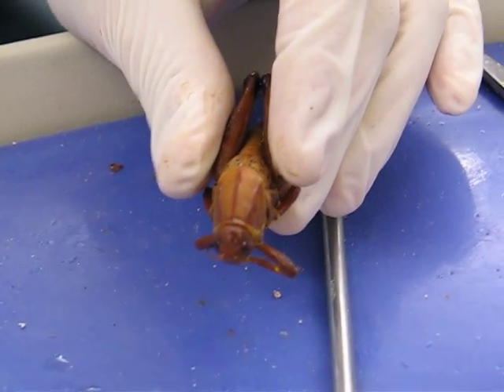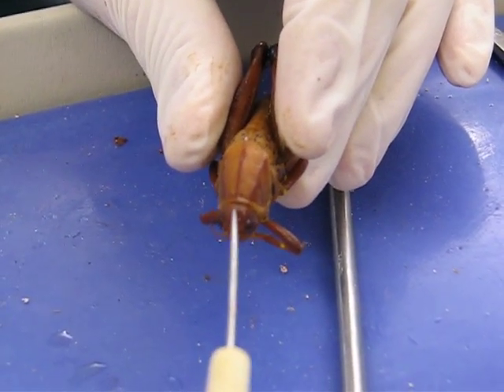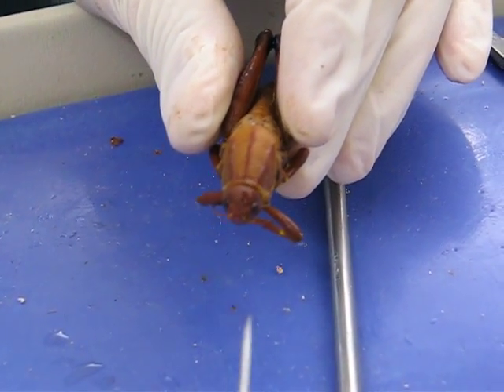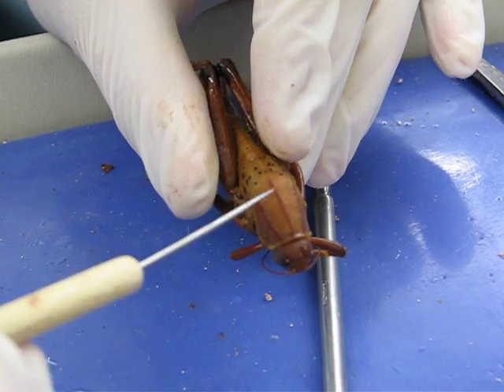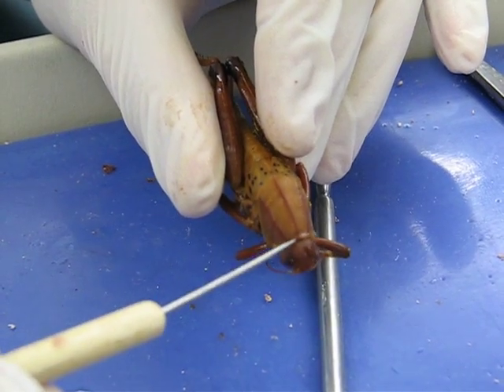The first name is the head. Head. Prothorax. Prothorax.